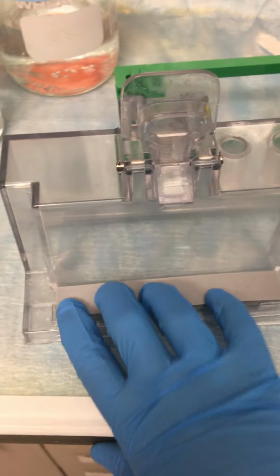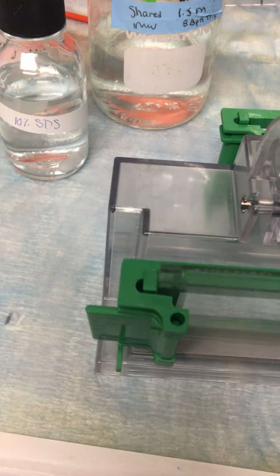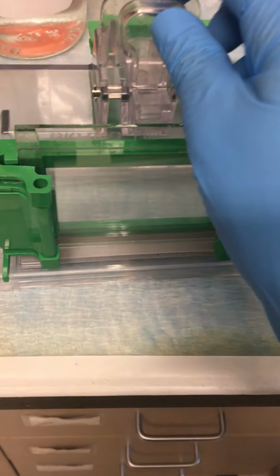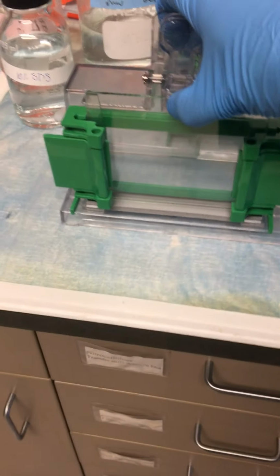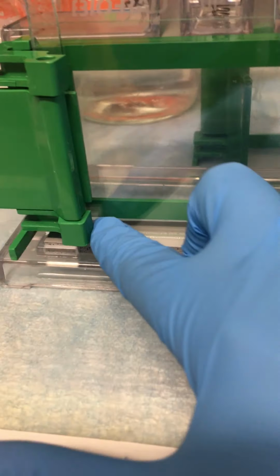So then we have these guys back here. They've got this squishy thing and then a clamp. And I'm going to put this down here and bring the clamp up so that it holds down the bottom of the plate. So now this is pretty sturdy in there. And now you've created this seal on the bottom.